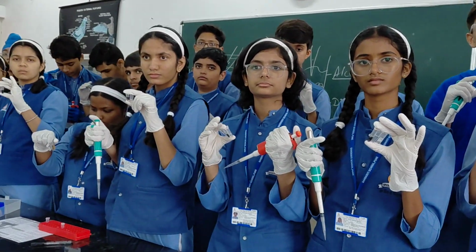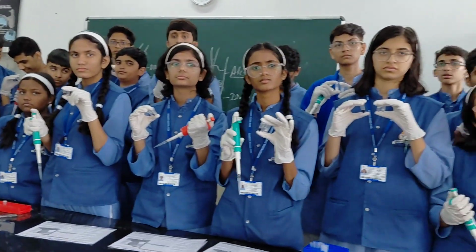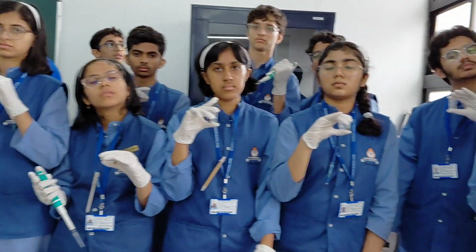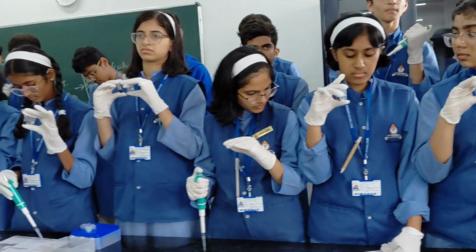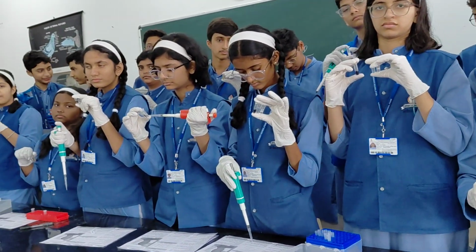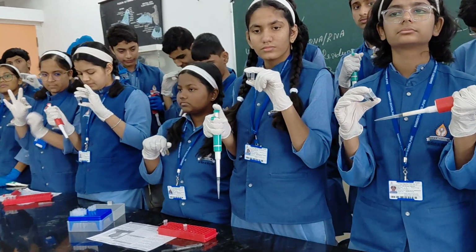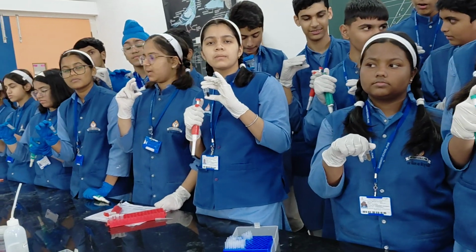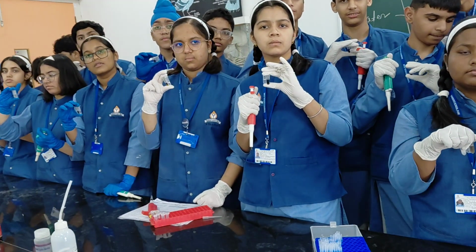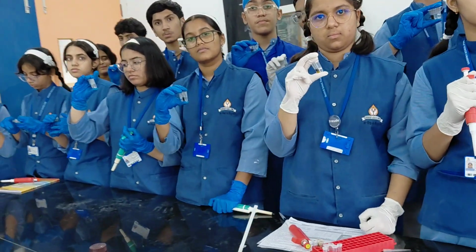To see the DNA, you need to run electrophoresis. In electrophoresis, there are two buffer solutions called TAE and TBE. TAE is made of Tris, EDTA and acetic acid. TBE uses Tris, EDTA and boric acid. That's called TBE buffer solution.